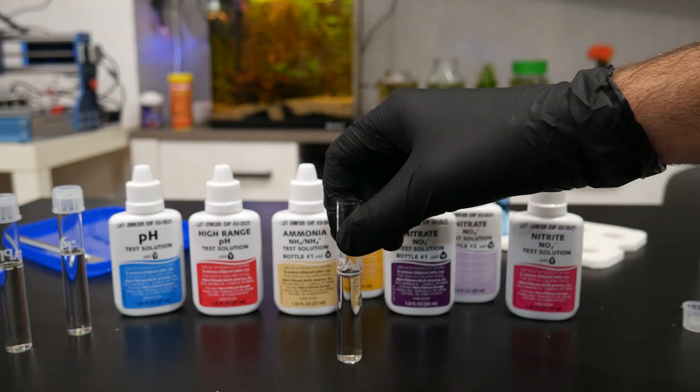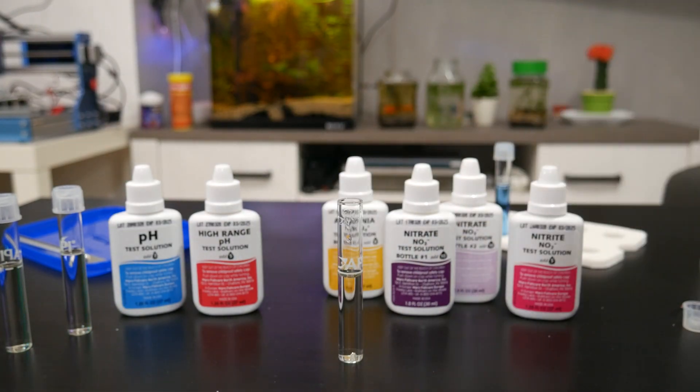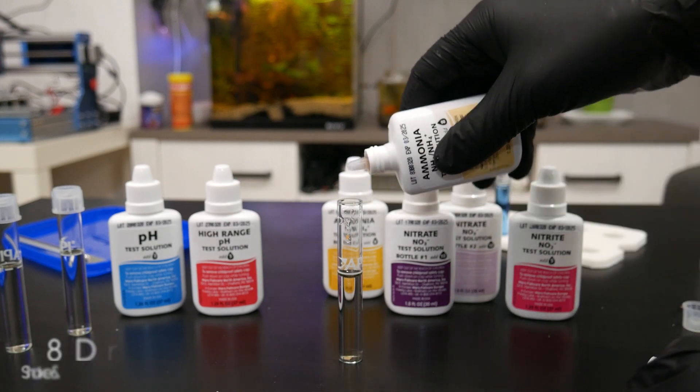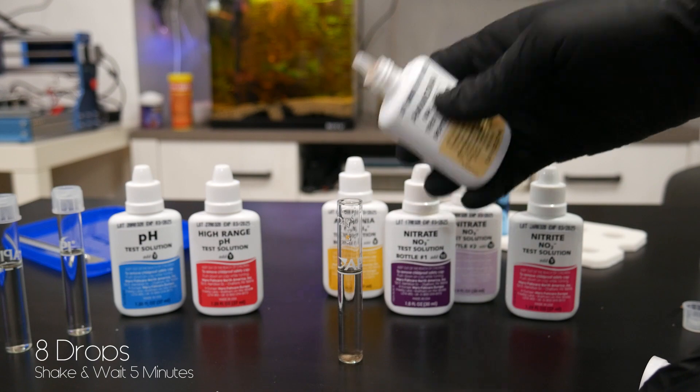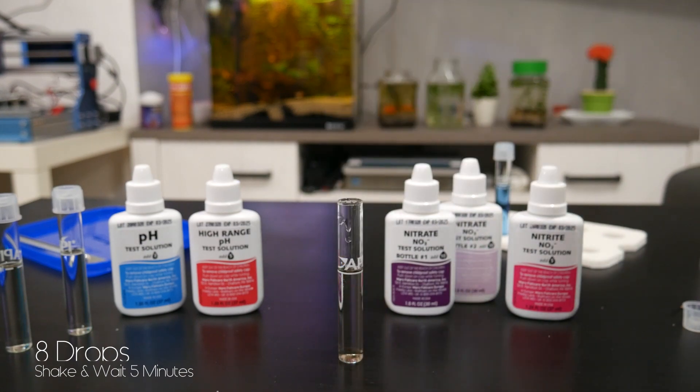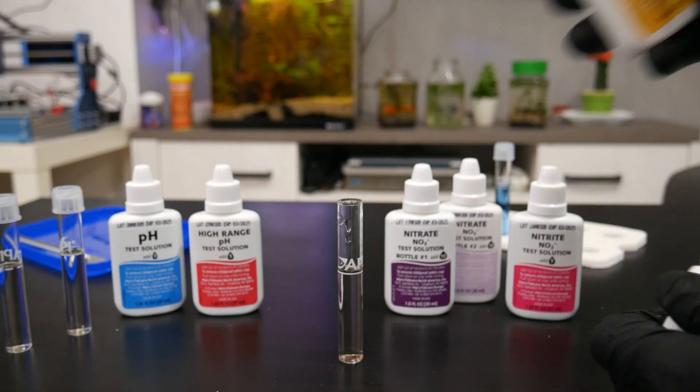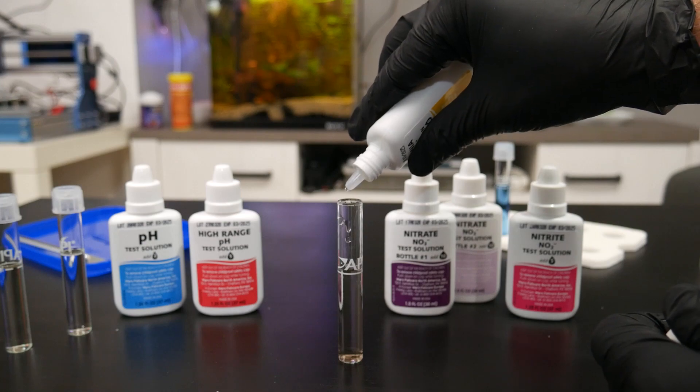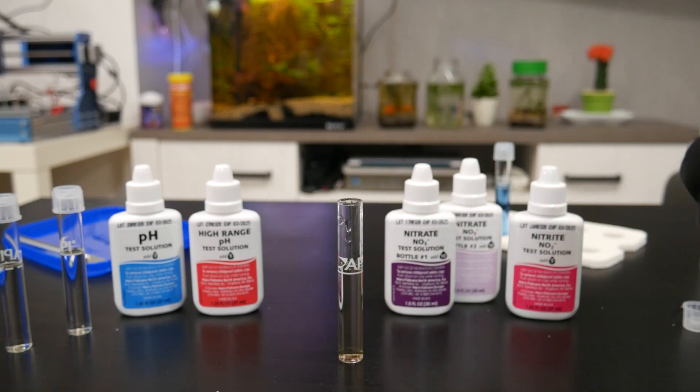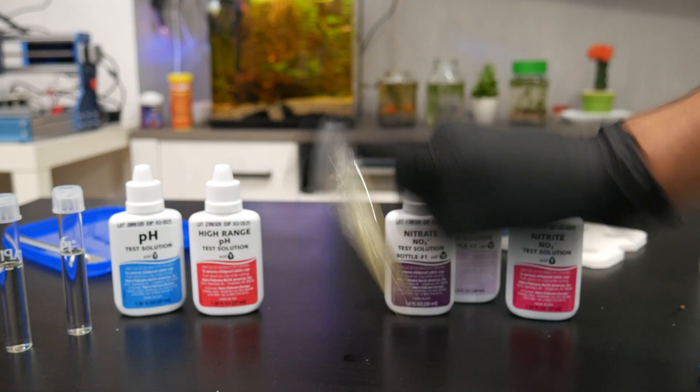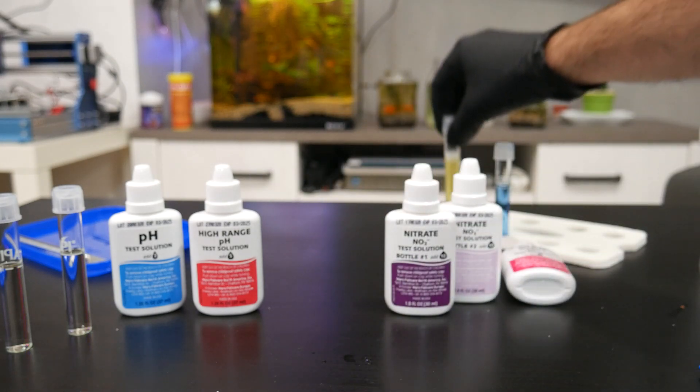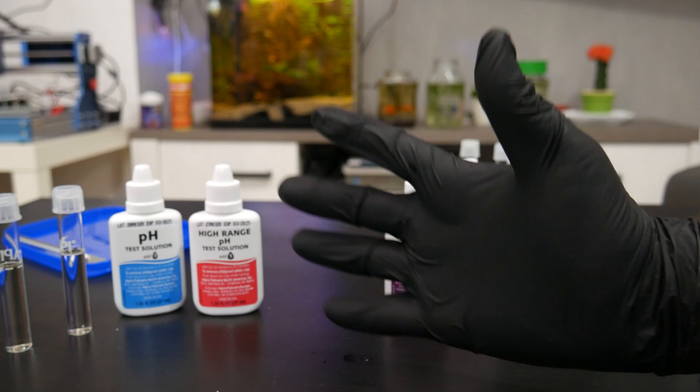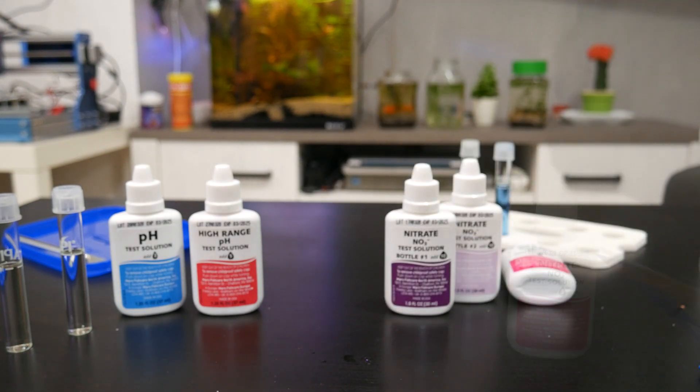Now we will use ammonia. We need eight drops from each bottle. This one we need to shake vigorously for five seconds. We need to wait for five minutes until we can read it.